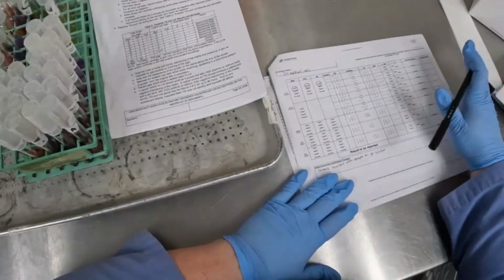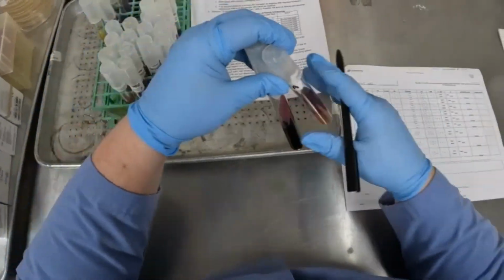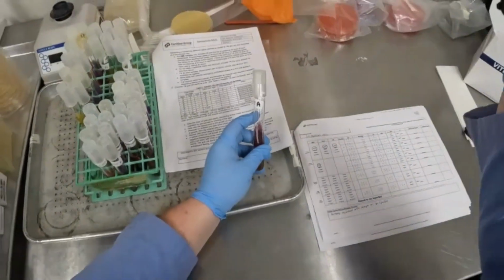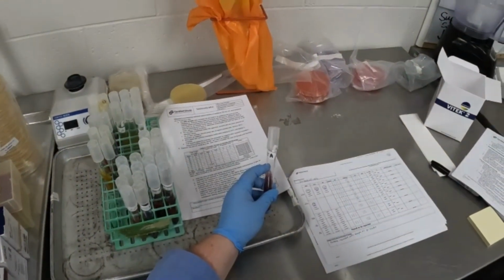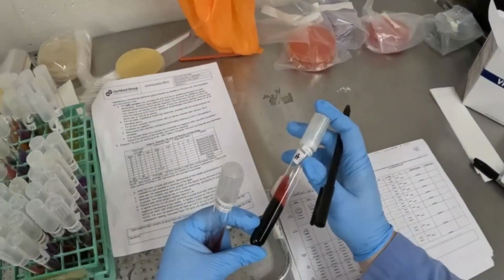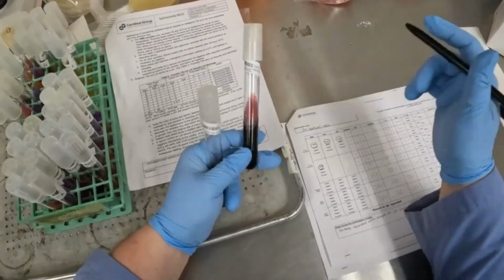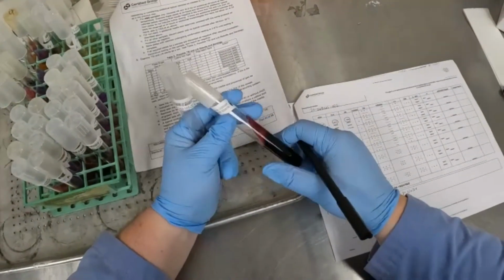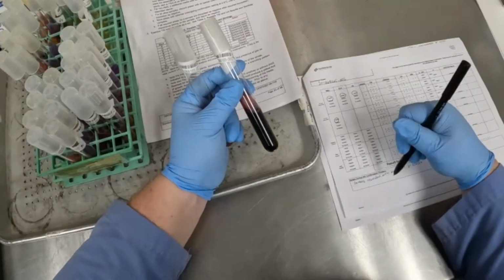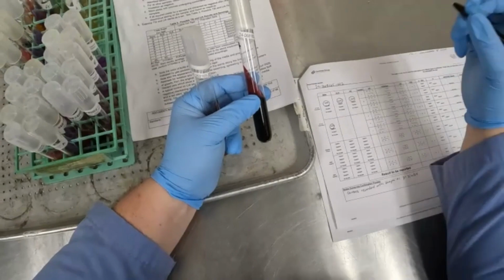Okay, so let's take a look at our sample 2. Let's take a look at isolate A and look at their reactions. So isolate A, we cannot even see what color it is on the butt because of the H2S production. It's very, very strong H2S production here. So I'm just going to put a note: H2S production blocked the ability to see the butt reaction.